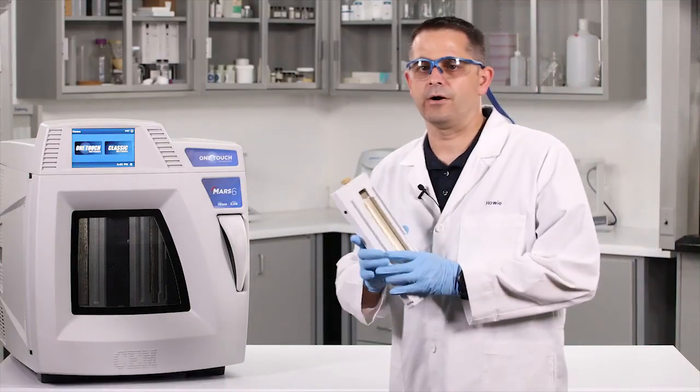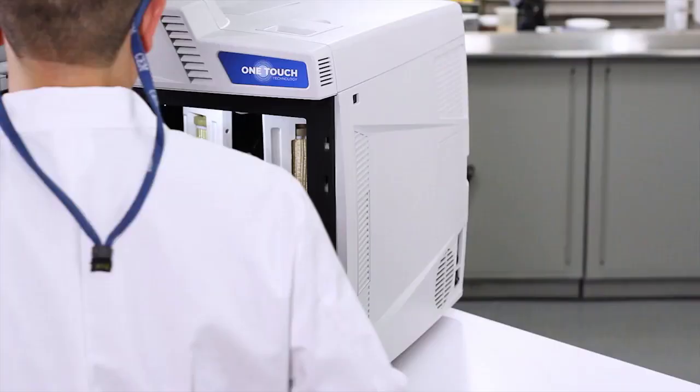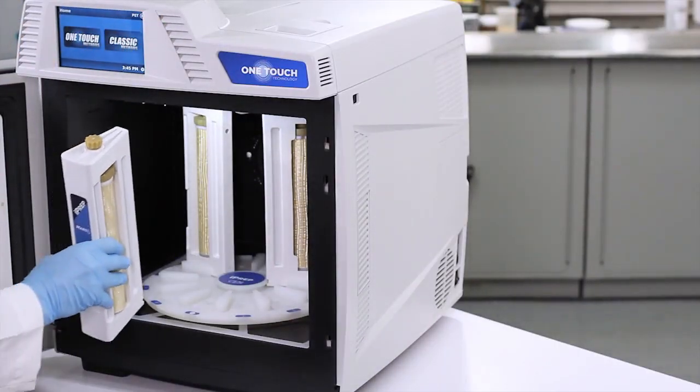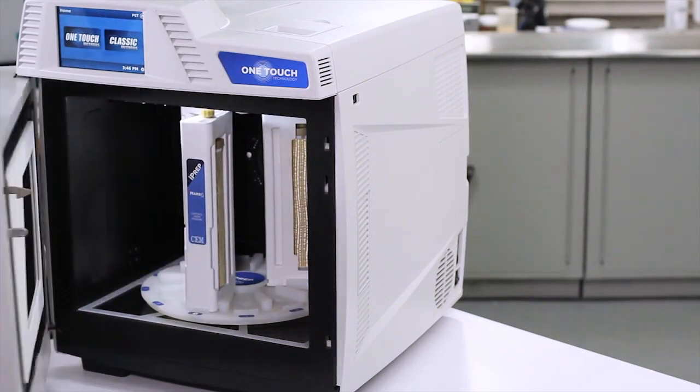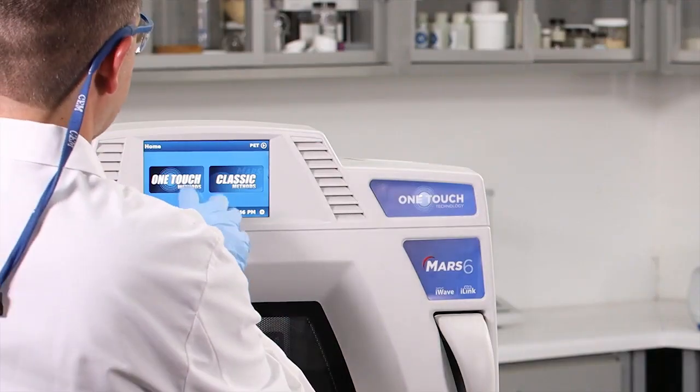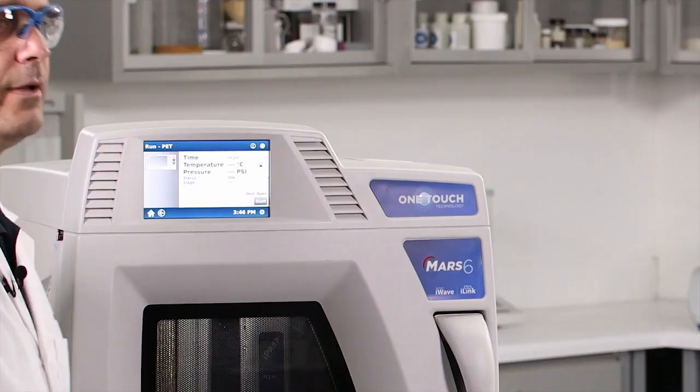Okay, now that we have prepped our last sample, we're going to put it in the microwave. We've got a total of three samples in here, and we're going to select our PET method. Hit start! Fire in the hole!